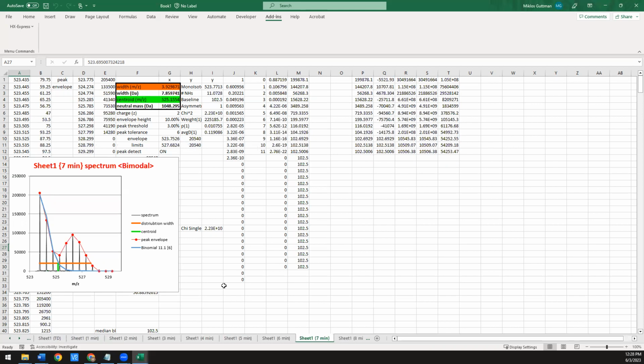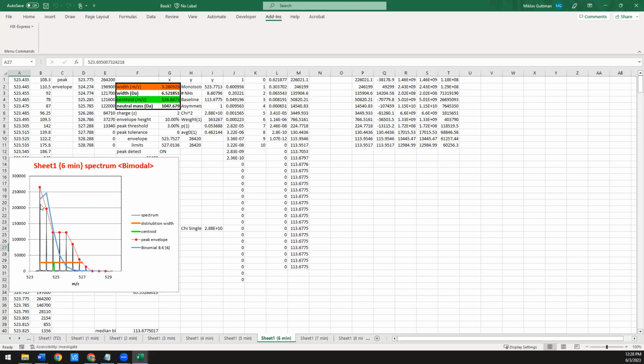So here, for example, this is a mixture of undeuterated and a peptide that was fully deuterated, but only in 50% deuterium. So here you still have two populations, but they're not nearly as well resolved. But you could still see that that single binomial just isn't able to fit well to the data. And in this case, you have 8.6 as the number of amides.